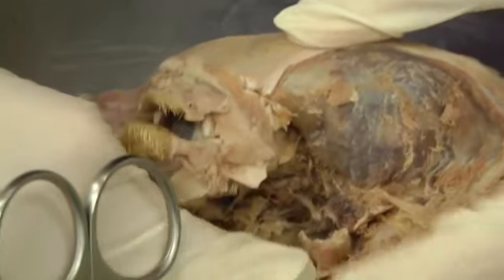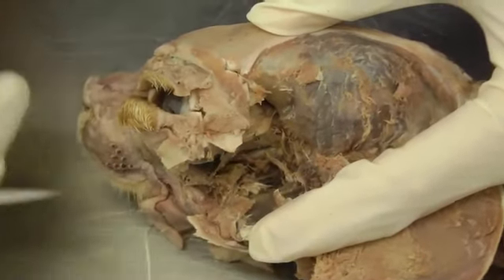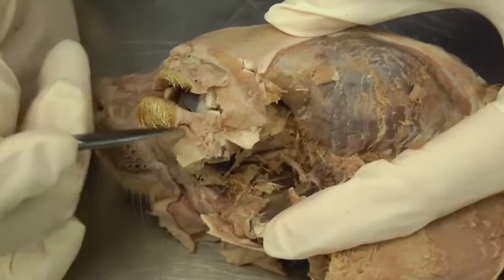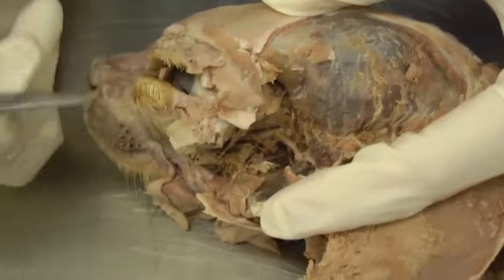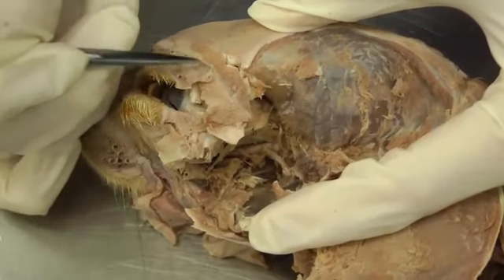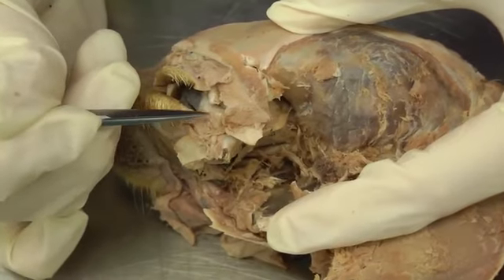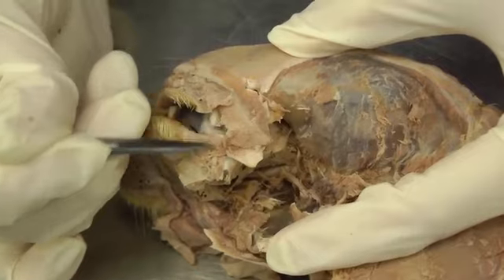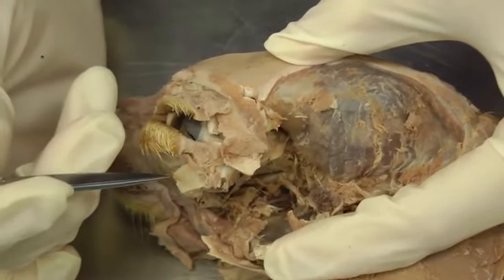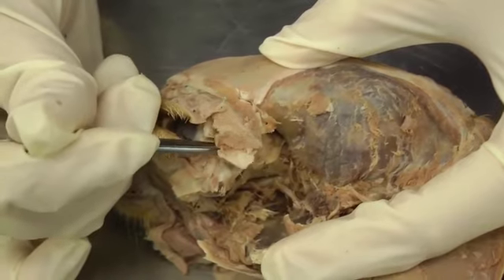So I have pulled out the jaw a little bit here, the mandible, and so you can see in this space. And you're going to reflect your, well, basically the orbital ligament is very short in a cat. So the orbit is the conical space that contains the eye. And the cat has a nearly complete bony orbit, and the dog had that really long orbital ligament. So in the cat, you may need to use rongeurs or something else to cut through this bony part of the orbit and reflect it up.